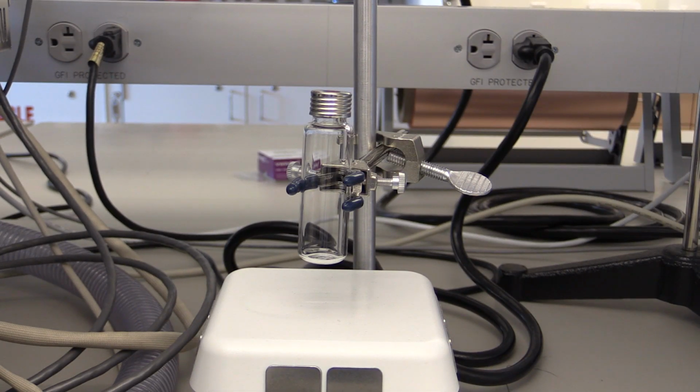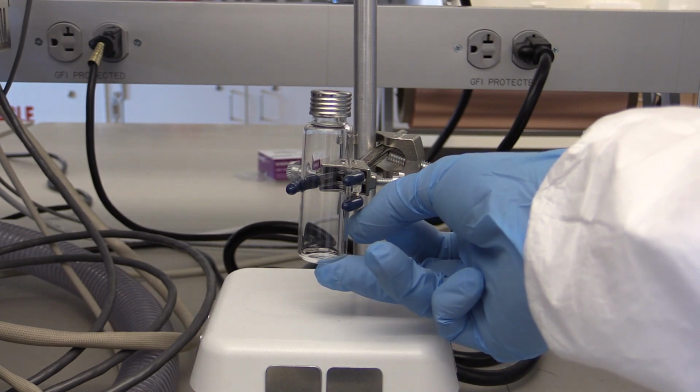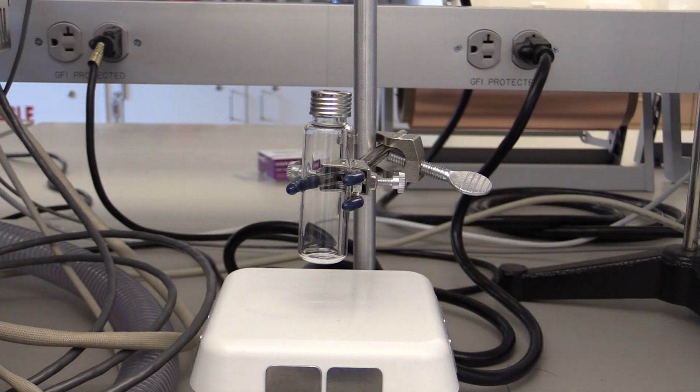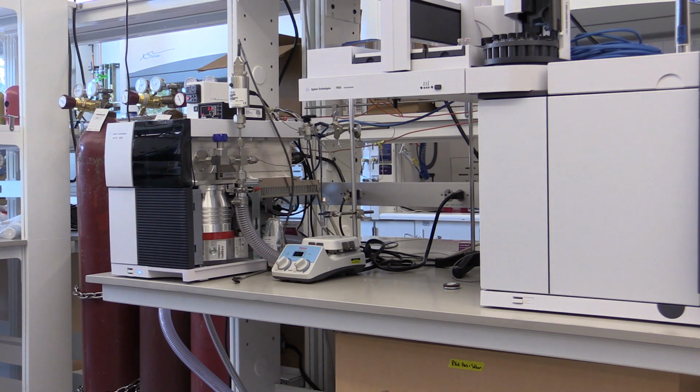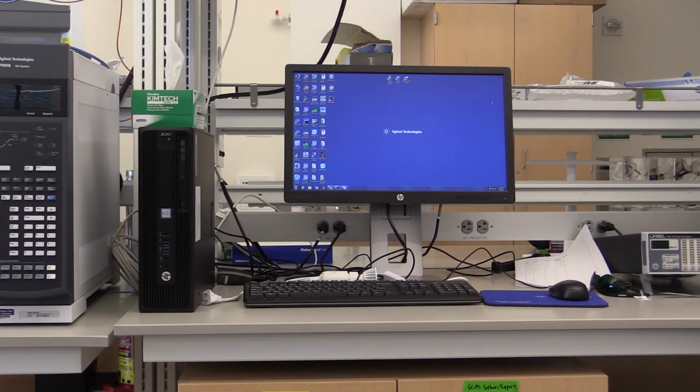When sampling your materials or gases, it's important that you only sample the headspace of the material. You do not want any liquid to go into the RTGA, because that can end up clogging it. When you're using this stainless steel tubing as your sample inlet, always stay in the headspace of your vial.